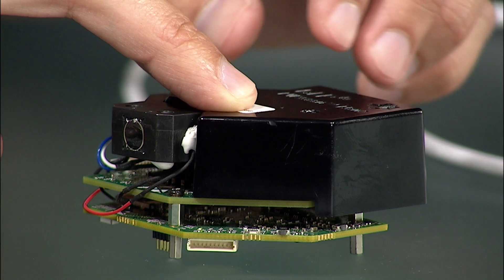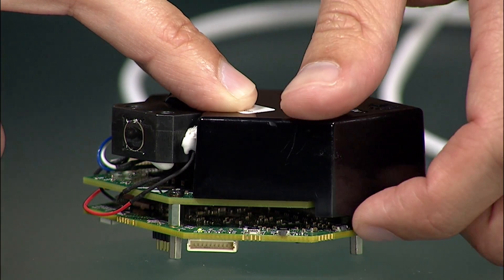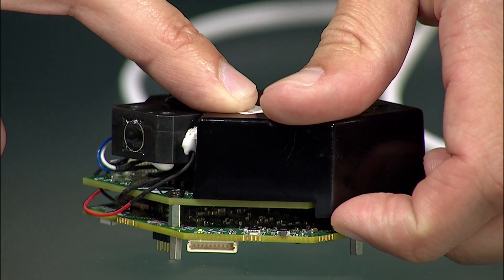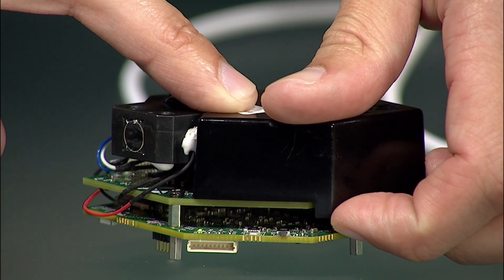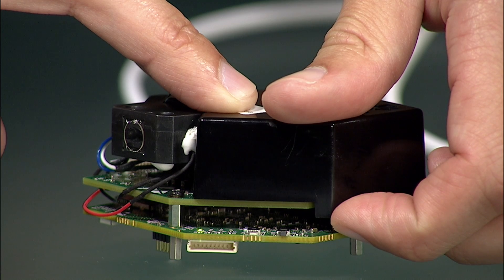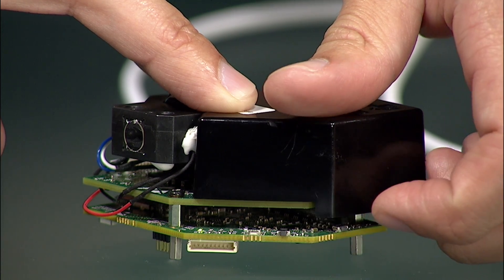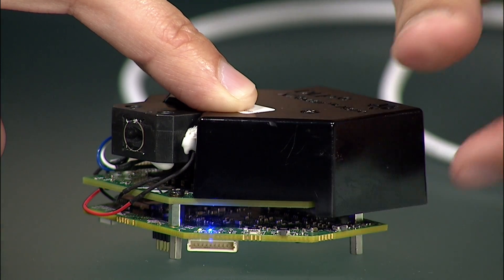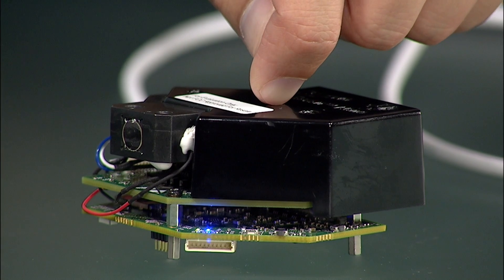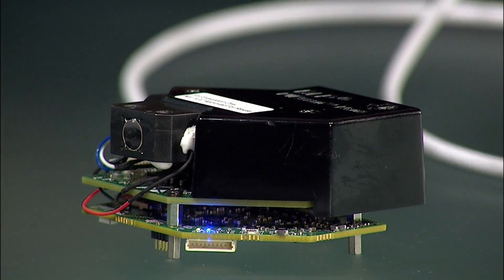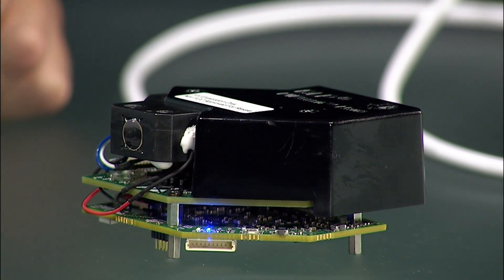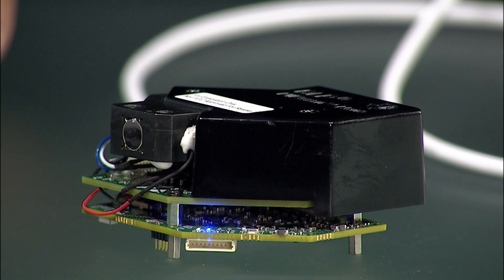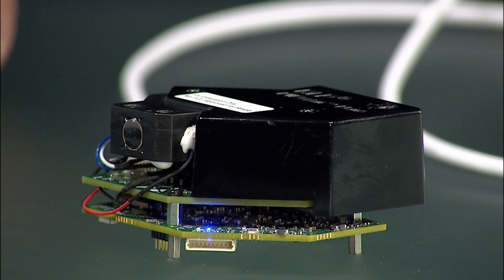When held down for more than three seconds, the Bluetooth subsystem powers up and advertises a connection. While a Bluetooth low energy connection is advertised, the blue LED will turn on. When a Bluetooth low energy connection is active, the blue LED will pulse on and off. The blue LED pulsing is independent of the green LED.